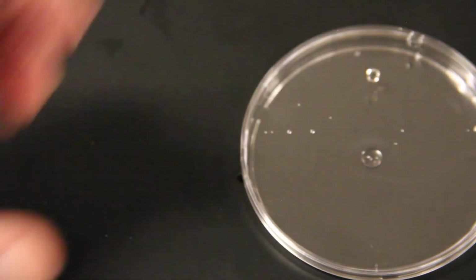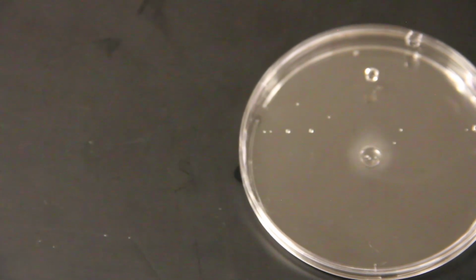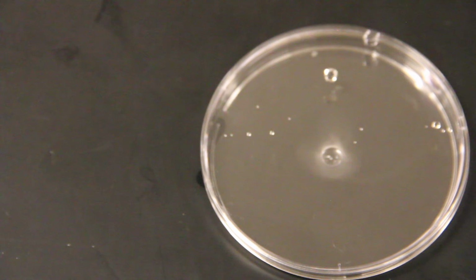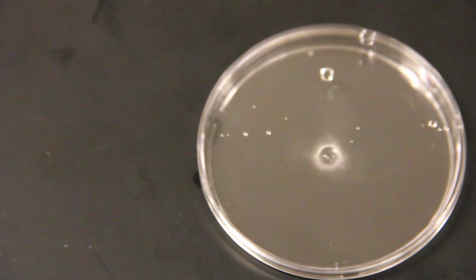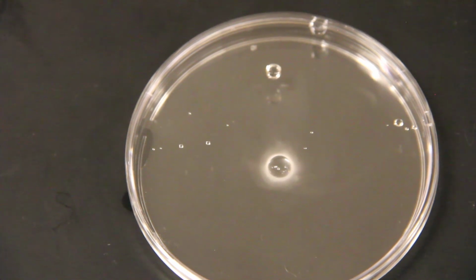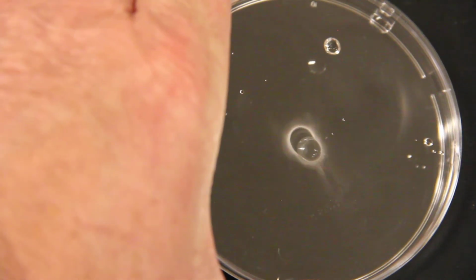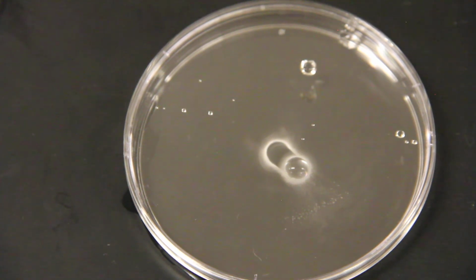and what we want is the ammonia, and you can see it starting to happen now where the vapors of the ammonia, ammonium hydroxide, and the hydrochloric acid are combining to form that whitish colored cloud outside of that. I'll see if I can zoom in on that even further for you. And there we go. And then if I tilt it around a little bit, you'll be able to see that there's actually a solid white ring of ammonium chloride that's left behind with the liquid.